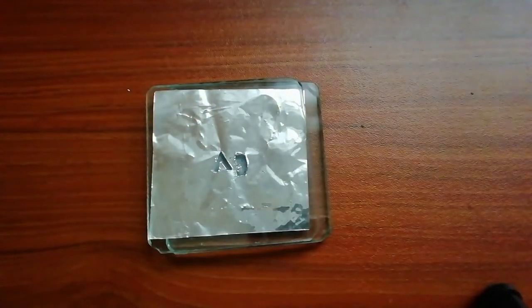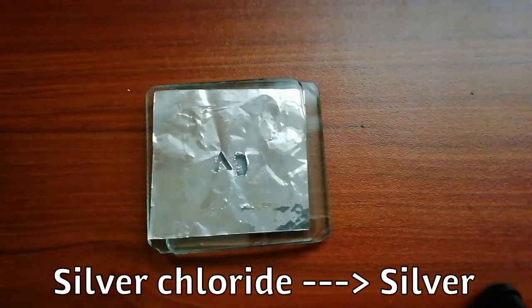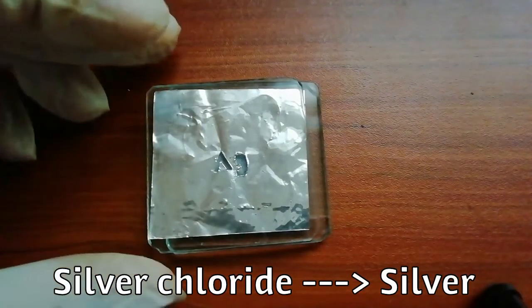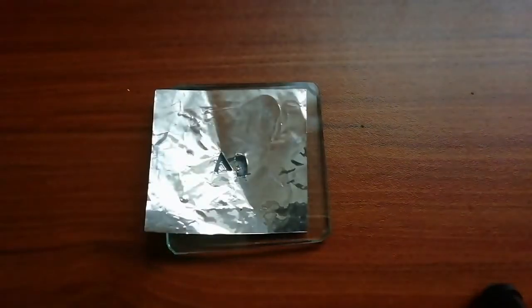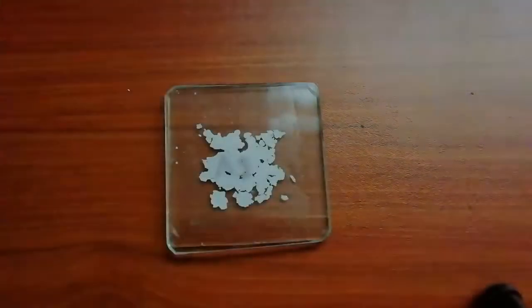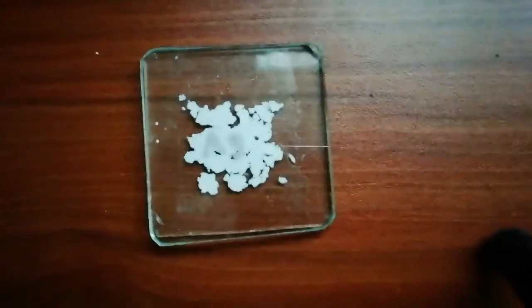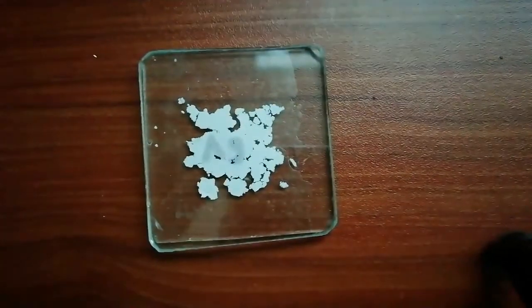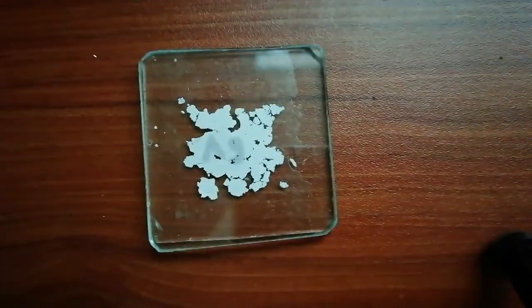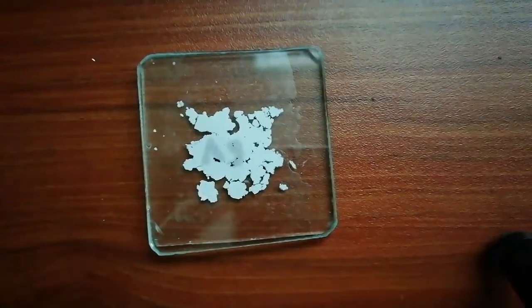After the reaction, let's see what happened to the silver. Now you can clearly see the AG mark on the silver chloride layer.